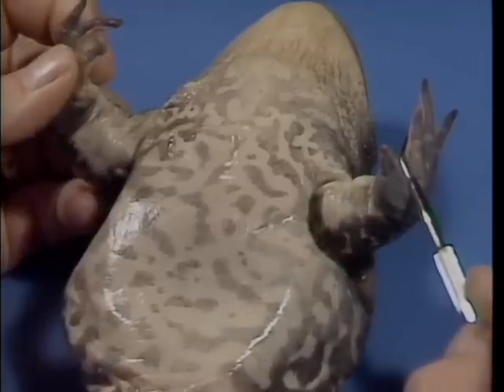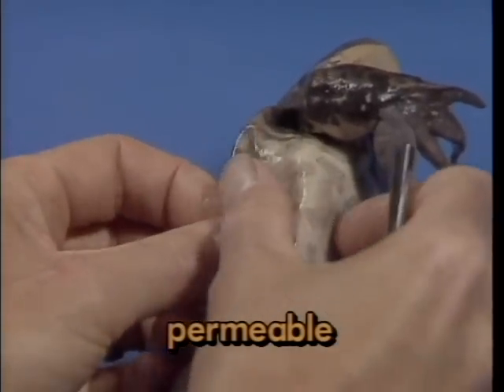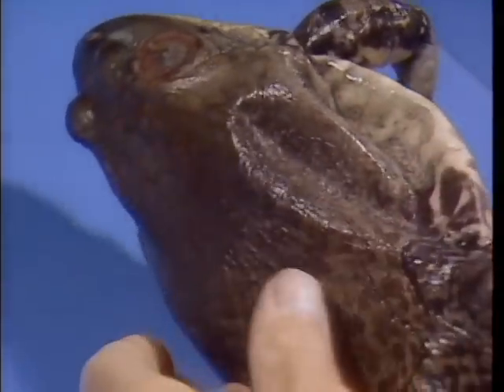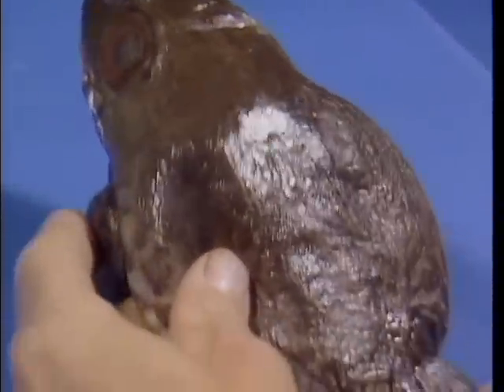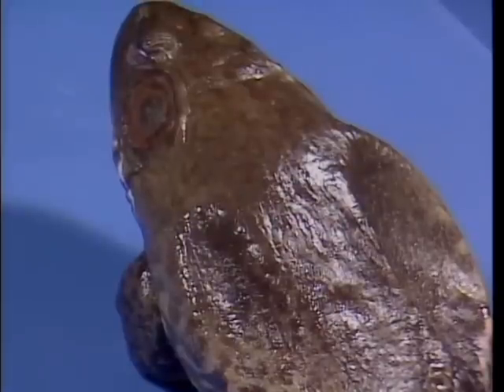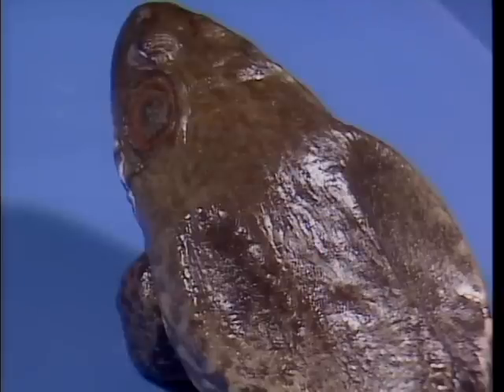The skin of the bullfrog is very thin, flexible, and permeable to water, meaning that water can pass through it easily. Because of these skin qualities, frogs don't drink water, but simply absorb it through the skin. As a consequence, frogs also lose body water rapidly and must stay in or near water in order to survive.